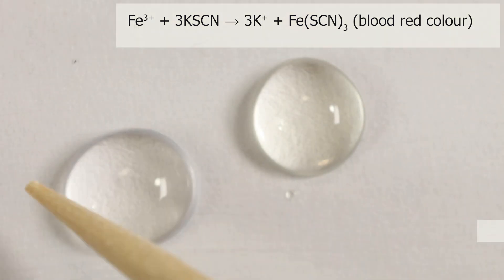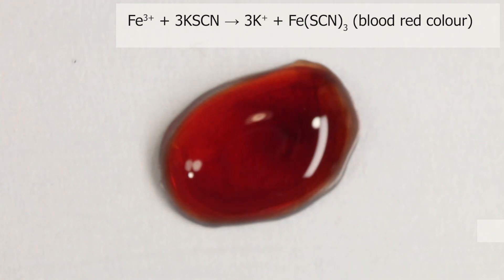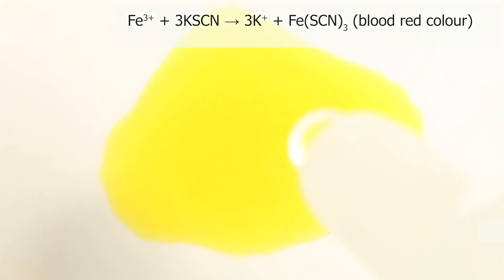Same on the micro scale. And at high concentrations.